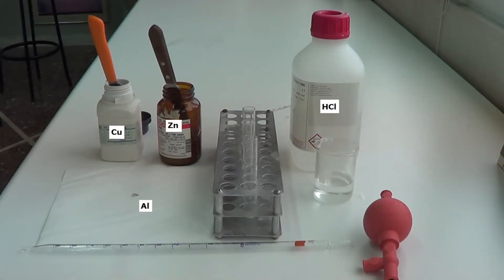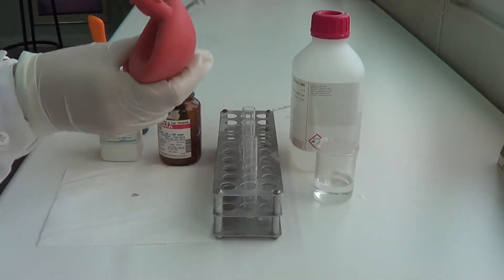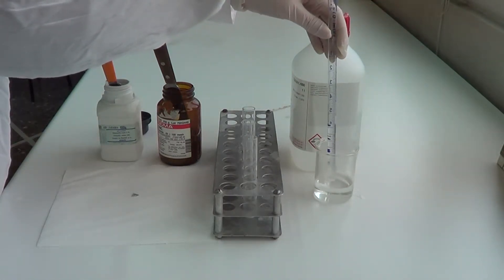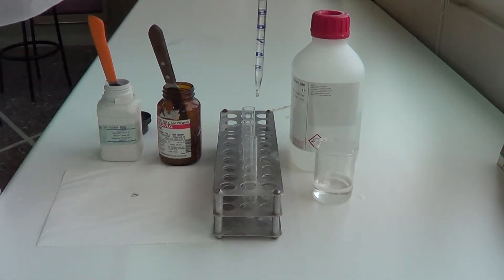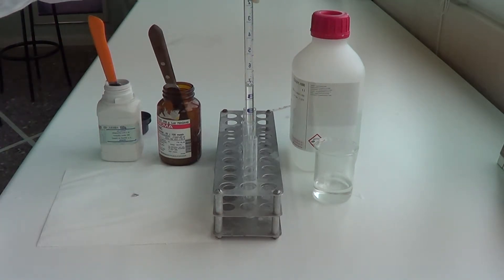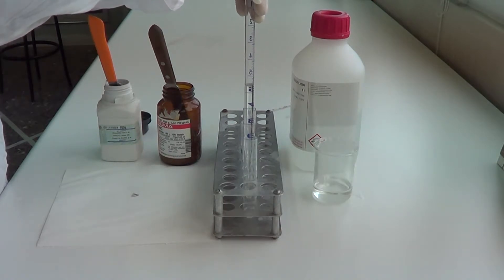We place 2 ml of hydrochloric acid in 3 glass test tubes.